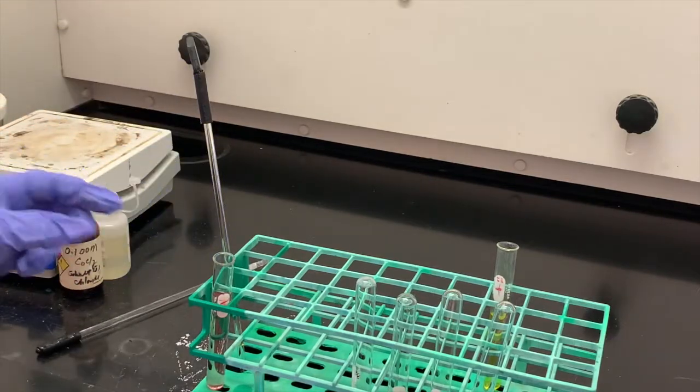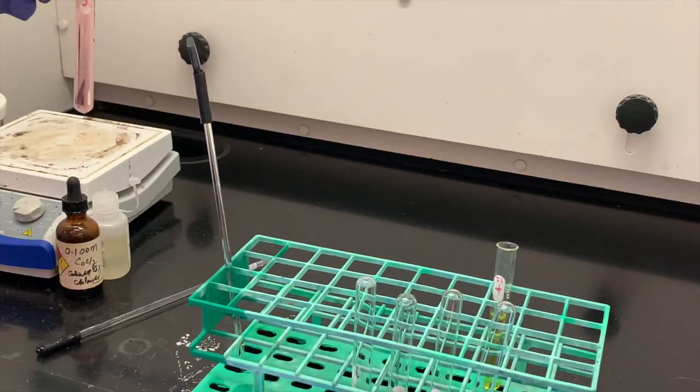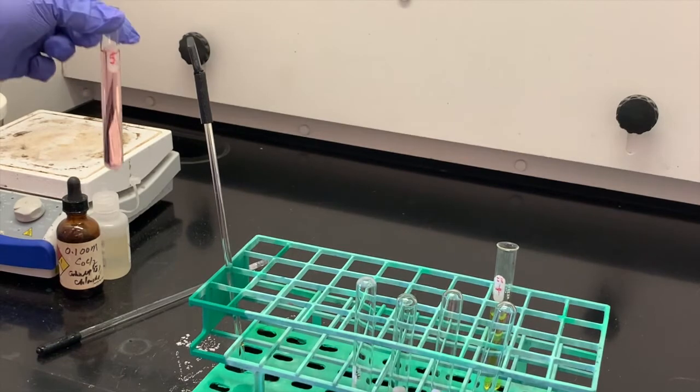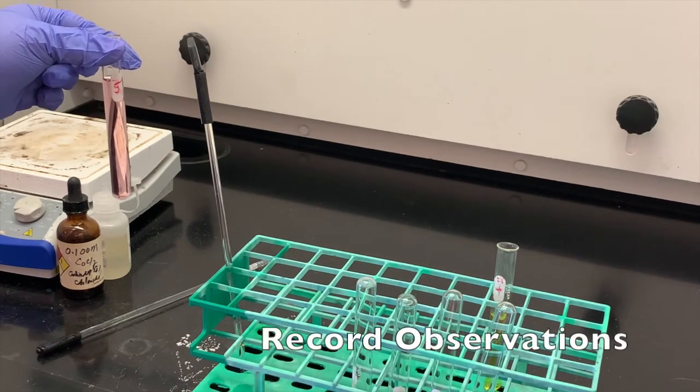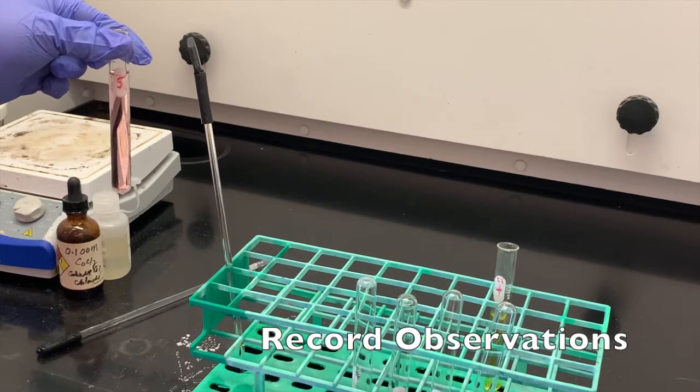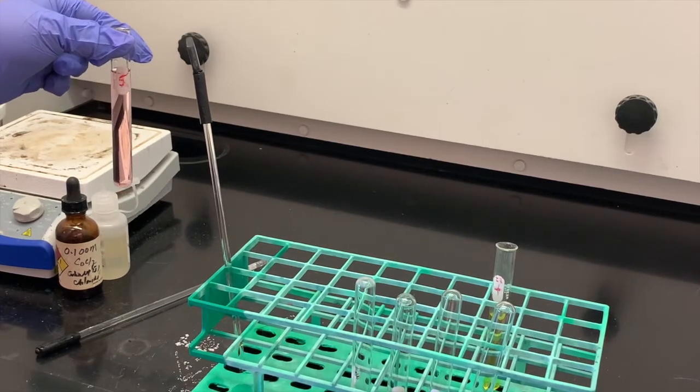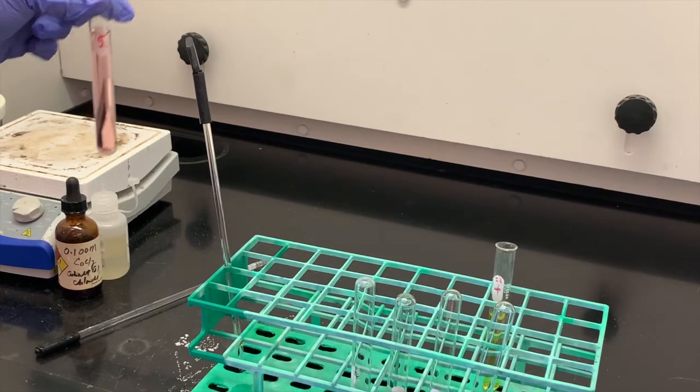So I just wanted to stir that up so that that reaction happens throughout the entire test tube. So you can see that there is a color change happened again. So this is when we added water to this cobalt-2 chloride equilibrium reaction.